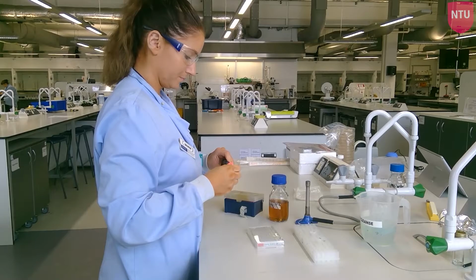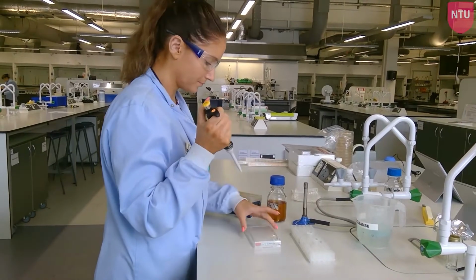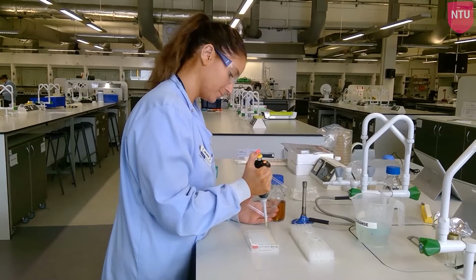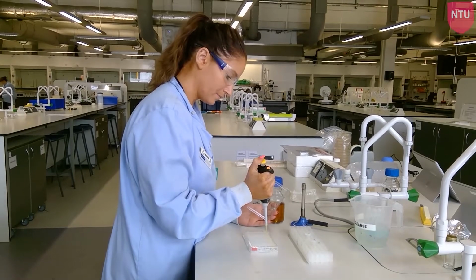You will now have 200 microlitres of media in well 1 with your desired concentration of antibiotic. This will now be serially diluted twofold along the wells in row 1 by transferring 100 microlitres from well 1 into well 2, and then transferring 100 microlitres from well 2 into well 3, and so on until you reach well 10.